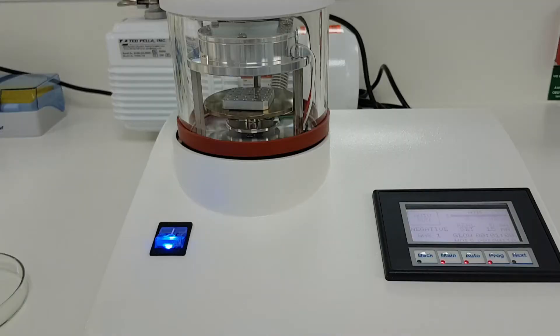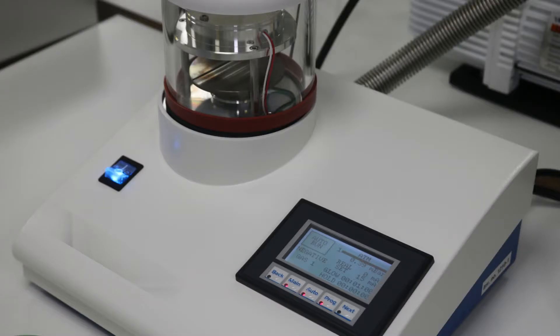This video shows how to correctly perform glow discharge of the electron microscopy grids for the MINI-TEM system using a grid glow discharge unit equipped with an oil pump.